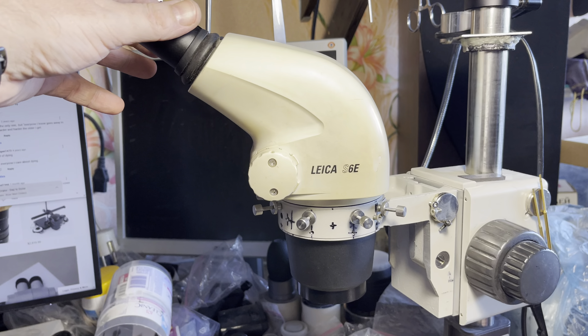First of all, I need to notice that all four Leicas I've received within the last half year all had cracks — severely cracked gears — such that if I had waited a bit more, I would have had those gears totally destroyed. The plastic got cracked in many places but still held on to the metal bronze base. If we wait a bit longer, this plastic would just detach totally from the copper-bronze ring, and after that it would not be possible to assemble things back.